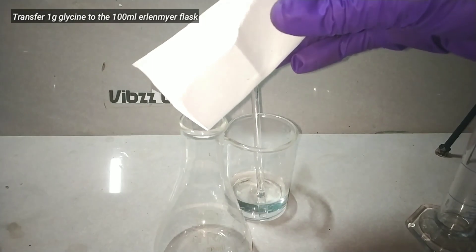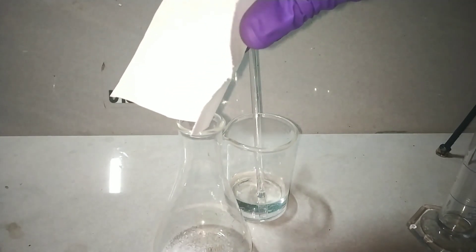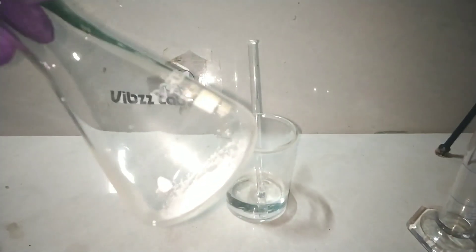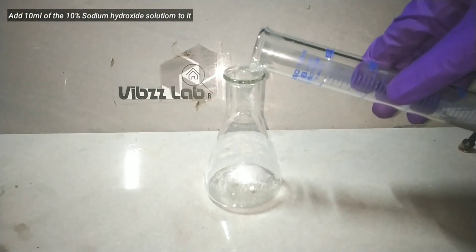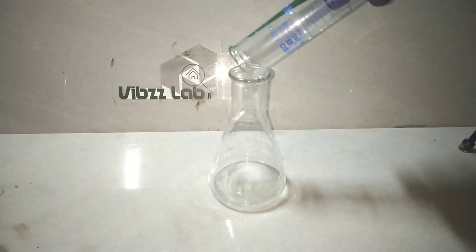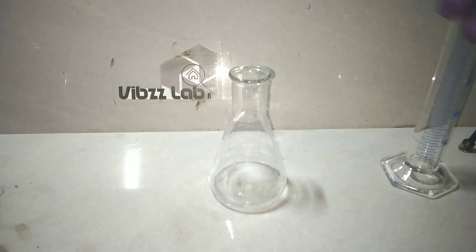Next, we take a 100 ml Erlenmeyer flask and transfer the already weighed 1 gram of glycine into it. Glycine is a white crystalline solid as you can see here. Now I add just 10 ml of the previously prepared 10% sodium hydroxide solution into the glycine. After that, we swirl the flask and dissolve the glycine in the sodium hydroxide solution.